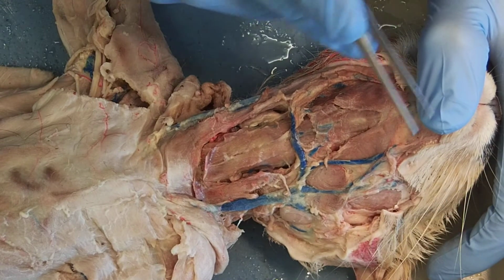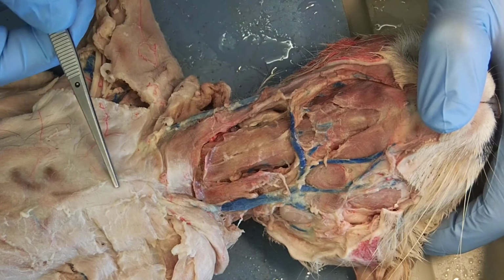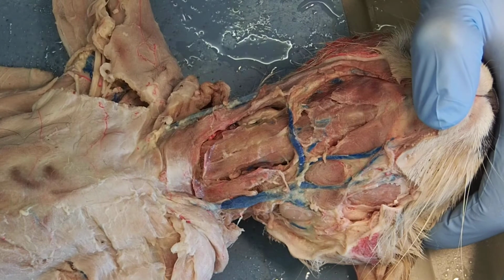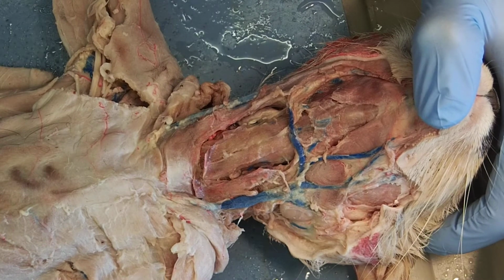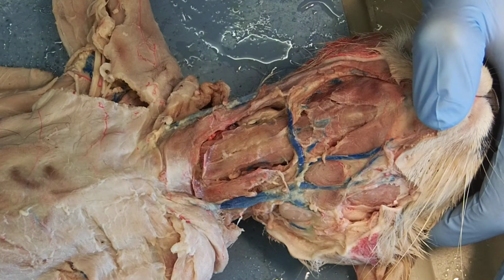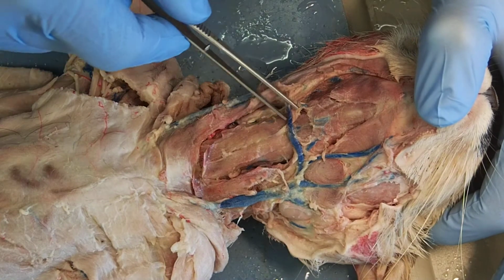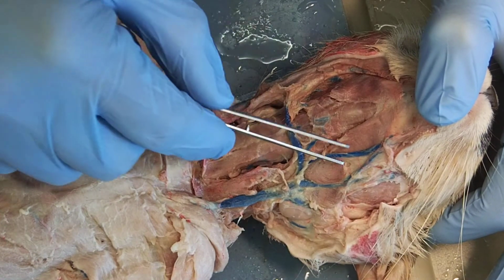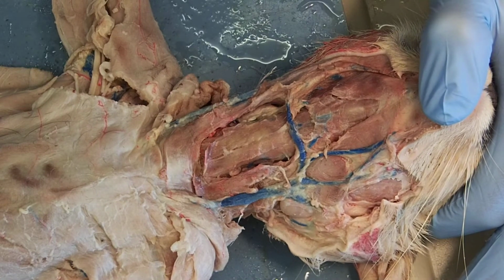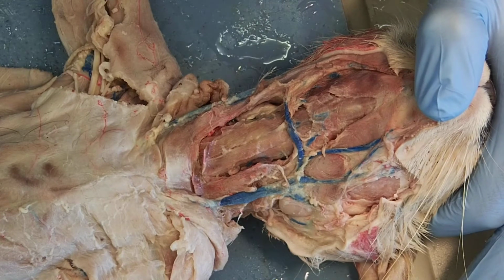So here my thumb is on the chin of the cat, and we're working our way down to the sternum posteriorly. You can see my external jugular vein running on both sides, and then running across you have your transverse vein, and then those jugular veins continue further up. We actually have some glands that you can see as well that I'm going to be pointing out.